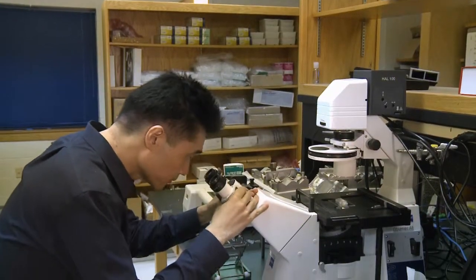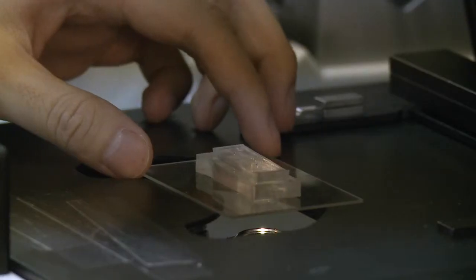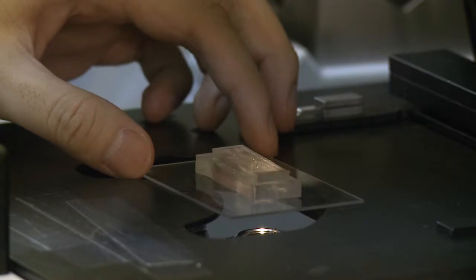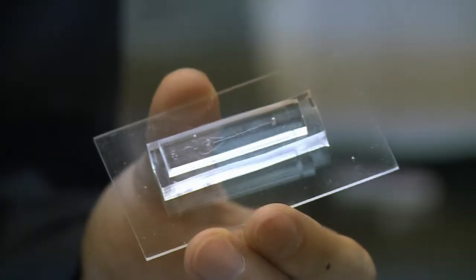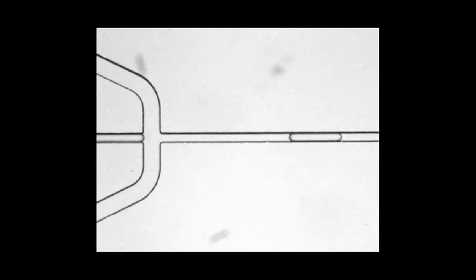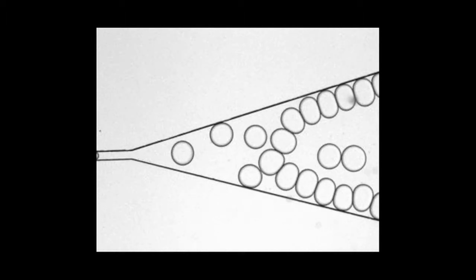So what we're doing is we're using something called microfabrication. The same process people are using to produce CPUs, to produce integrated circuits. Instead of producing the electronic device, we're using that process to produce a fluidic device. We call this a microfluidic device. And with that kind of device, we can basically generate many different droplets, and we can use these smaller droplets to trap individual cells inside them and put them into a long-term observation device and observe their behavior over a very long period.